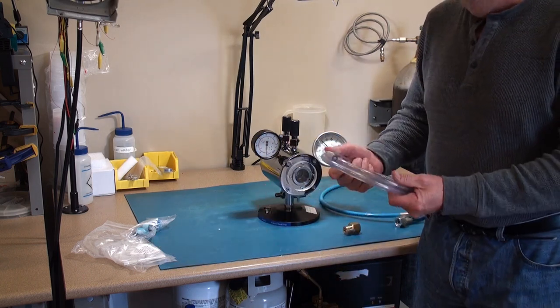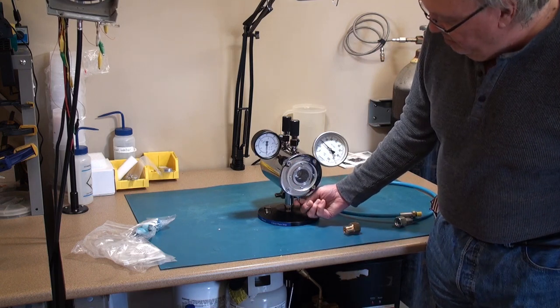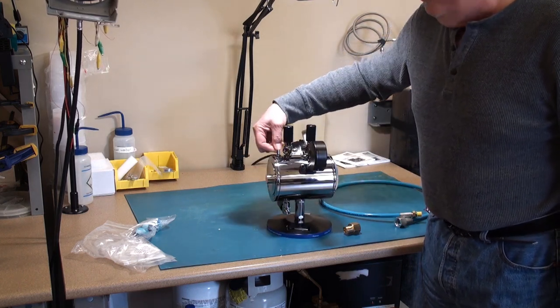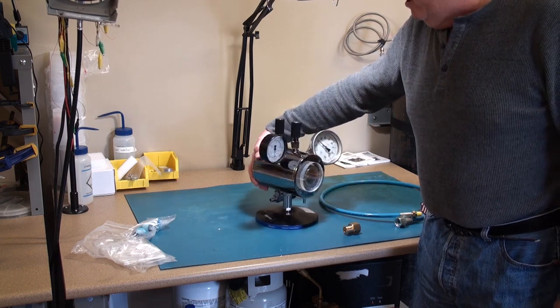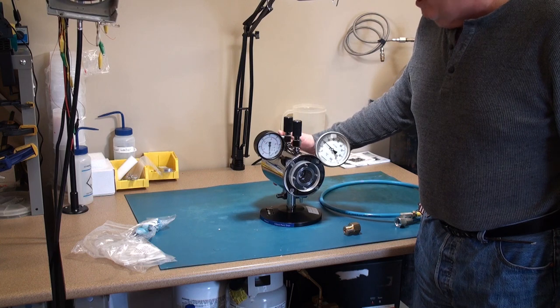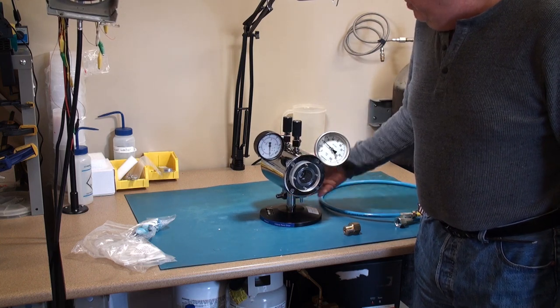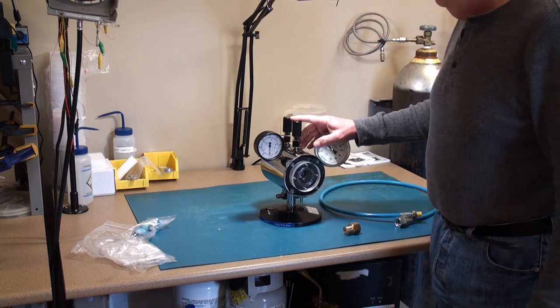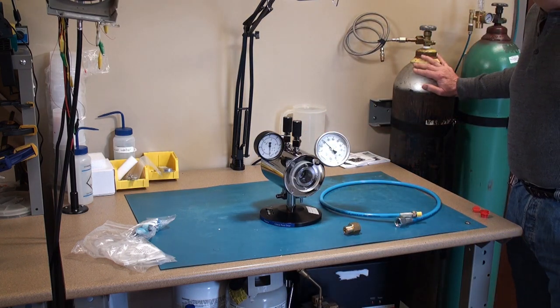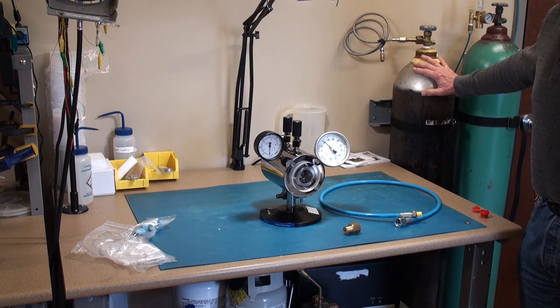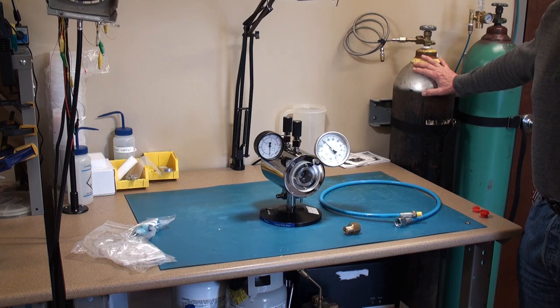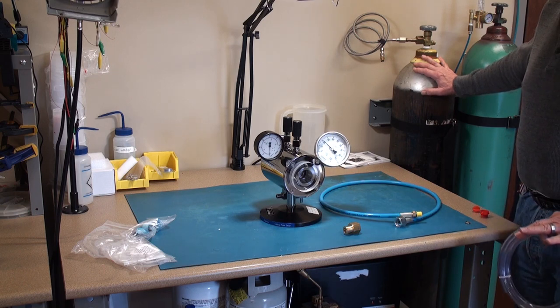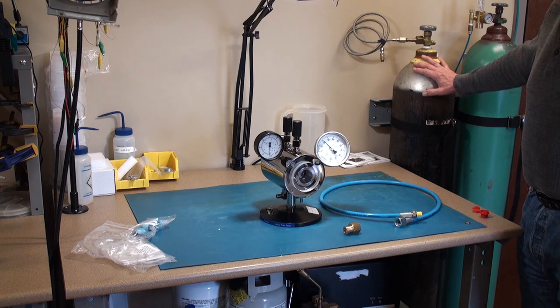You get two lengths of plastic tubing which attach here and then one in the back of the chamber that you can't see so well. One's a water inlet, one's a water outlet. It really doesn't make a difference on how you want to connect it. You see also two valves on top. One will be a gas inlet valve which will connect to the CO2 tank. The CO2 tank is a special tank. It has something called a siphon tube or a dip tube which delivers liquid CO2 unlike the standard tanks which only will provide you gaseous CO2.